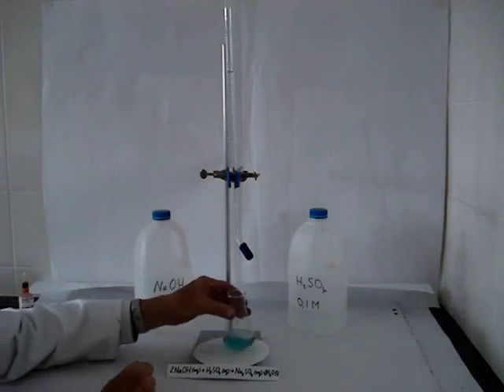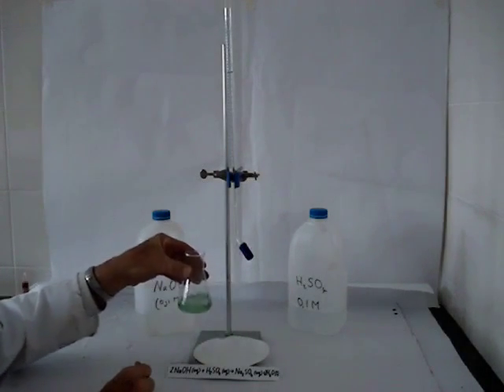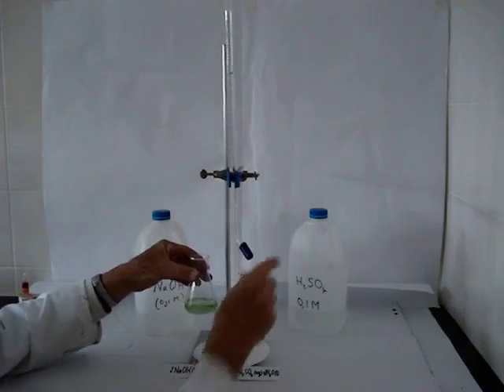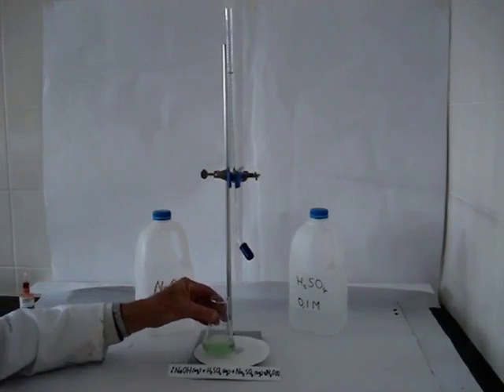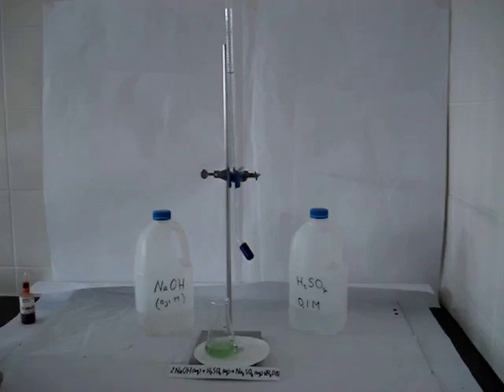And remember that for universal indicator, green indicates the presence of a neutral substance, and you see there we have reached the endpoint.